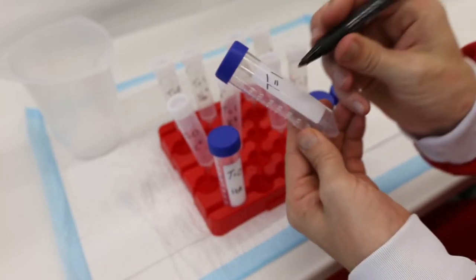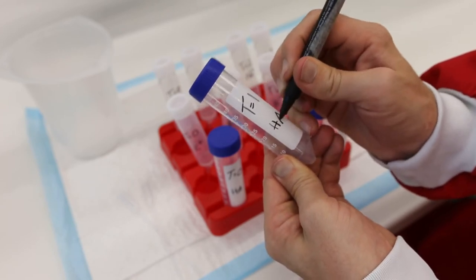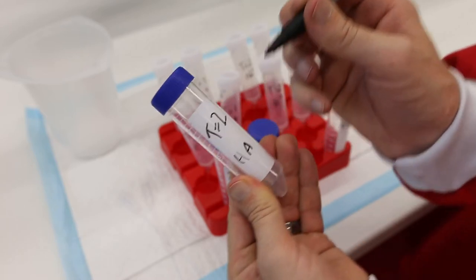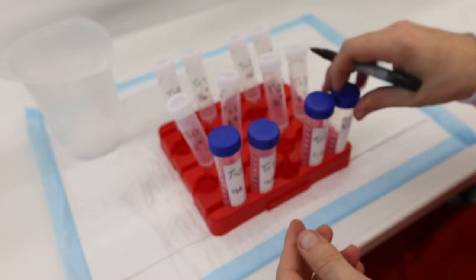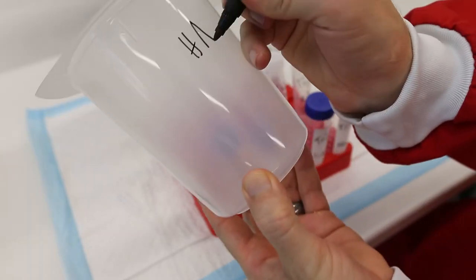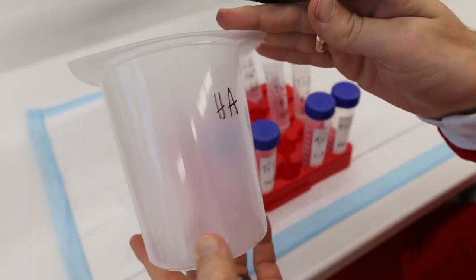Do make sure you include your initials on each of your tubes, since in between sample times you will be leaving your tubes on a bench put aside for this purpose, and you will need some way of telling your tubes from everyone else's. Lastly, make sure your beaker is also labelled with your initials.